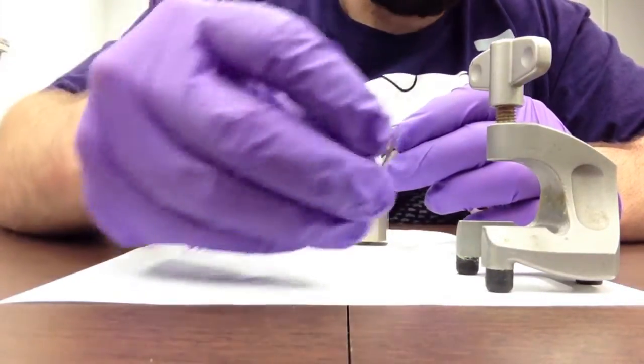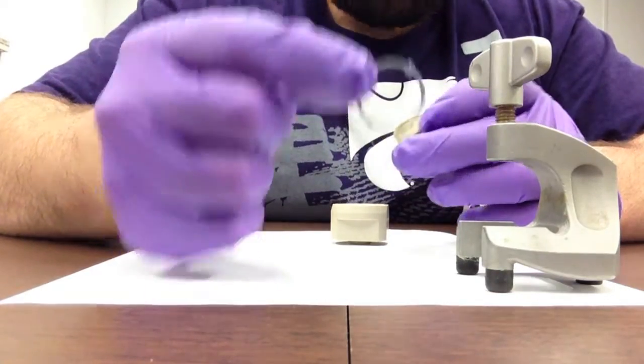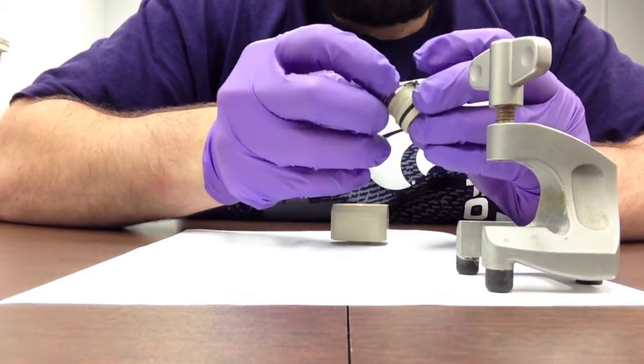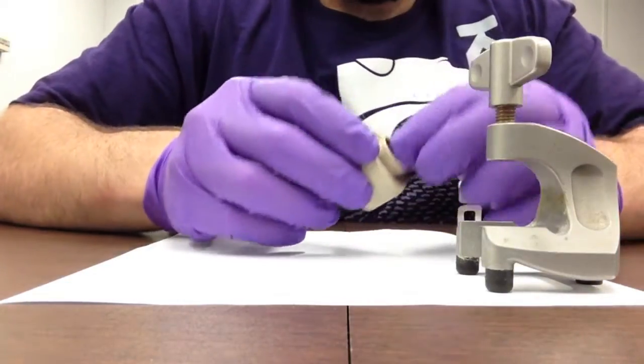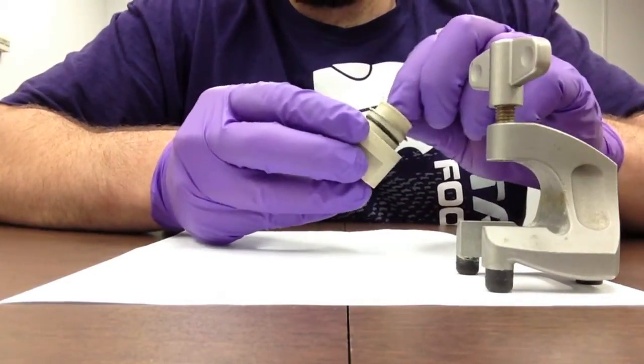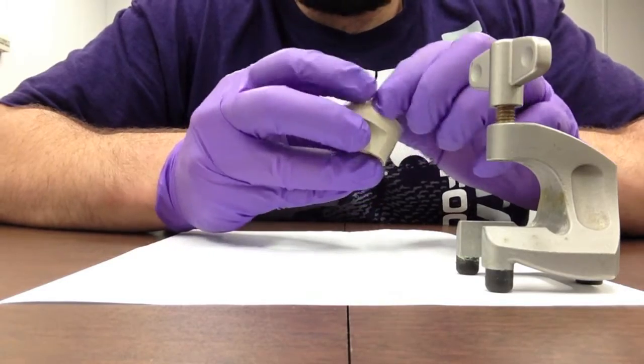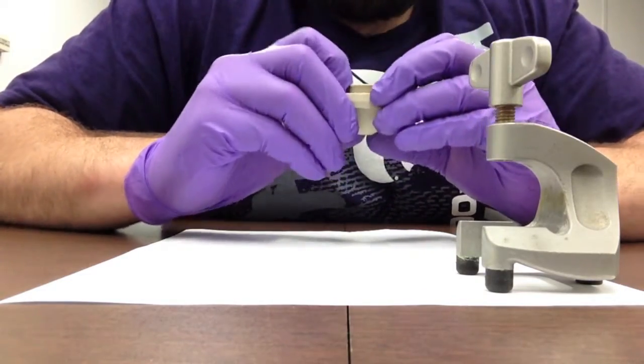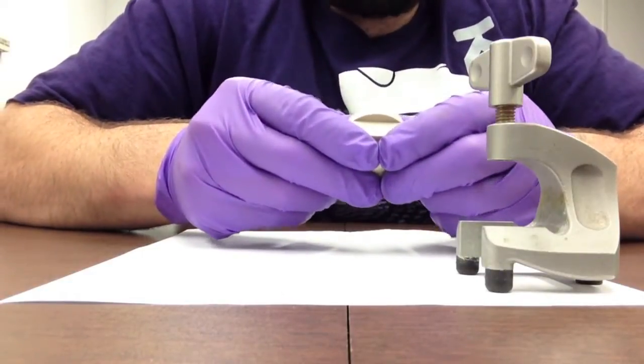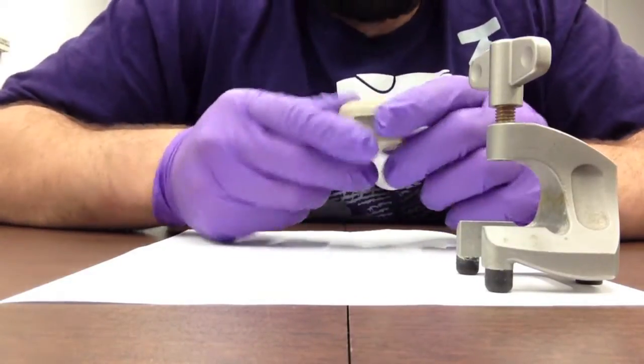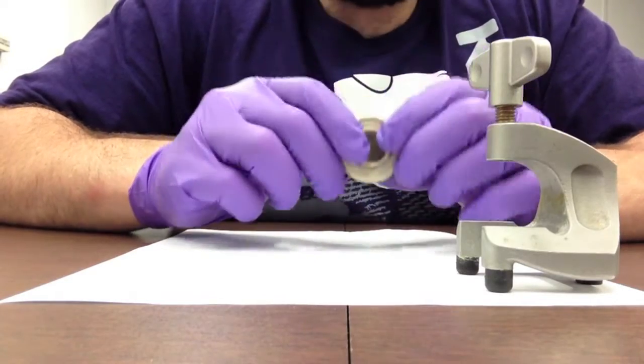There's a specially designed cotter key which lines up with the sleeve groove and the grooves within the base. Assembling it with the o-ring going down, it assembles in and aligns with the keys of the base. To seat the sleeve into the base, you need to press firmly on the ring and press it down until it reaches the base.